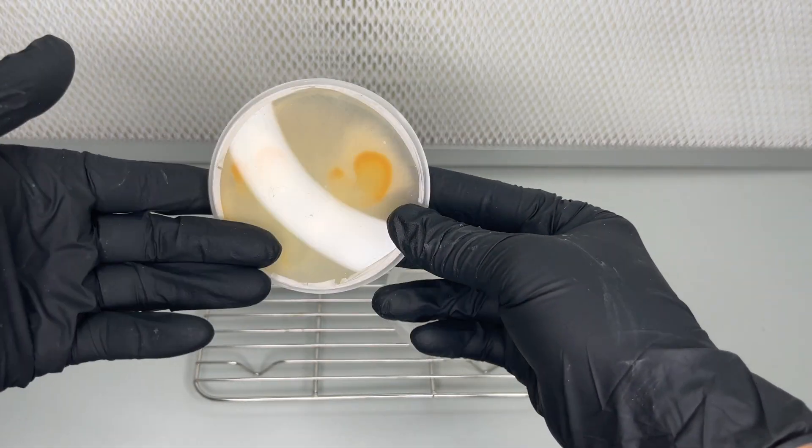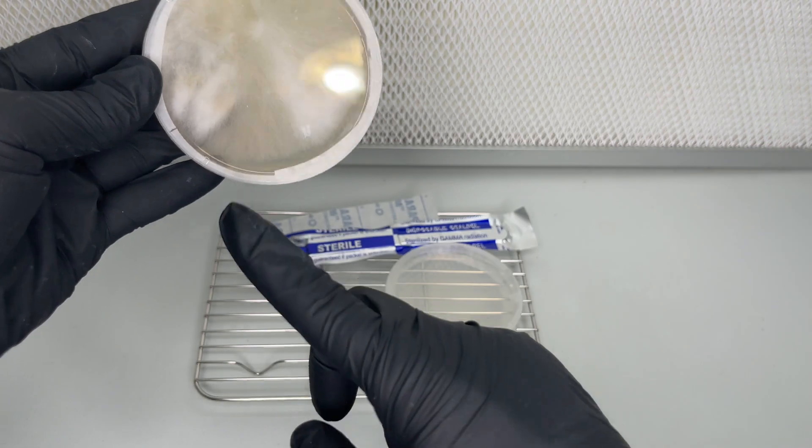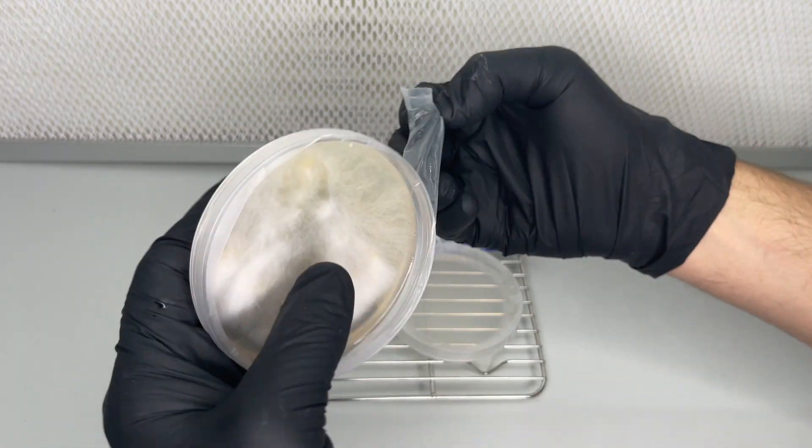In order to save this culture, we're going to select a section that we think is going to be clean and transfer it to a water agar plate.